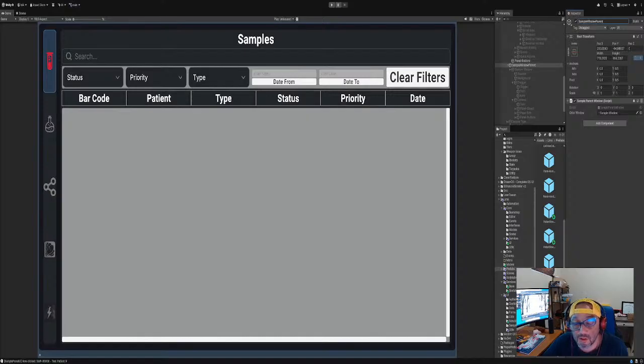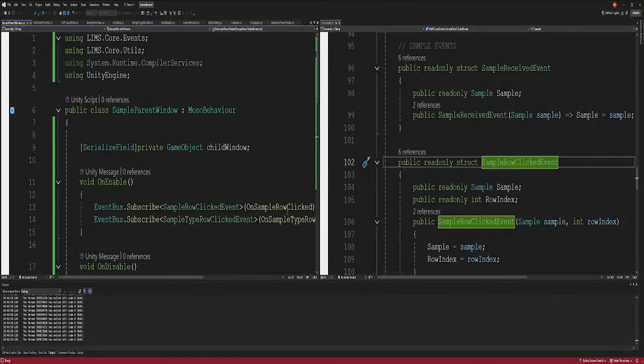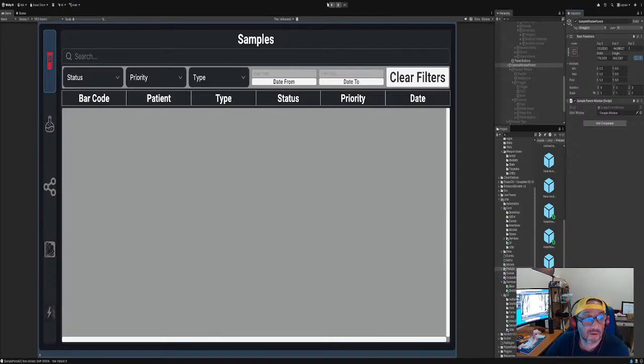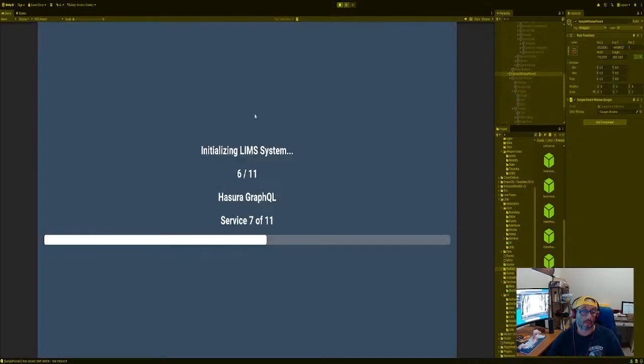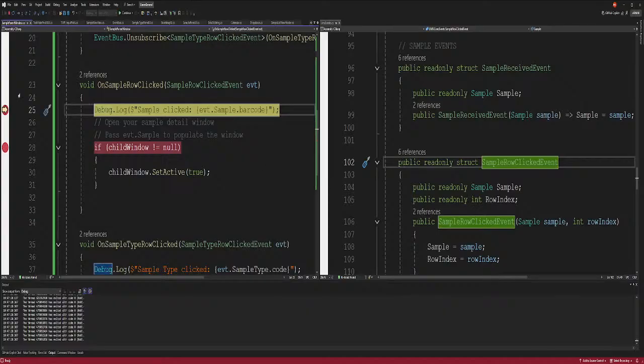And the sample window is supposed to be listening on sample row click, right? And we're listening for that. So that we got correct. All right, so let's see if it actually works. Now we'll work through it, see what's going on. There we go. And as you see, it's working now.